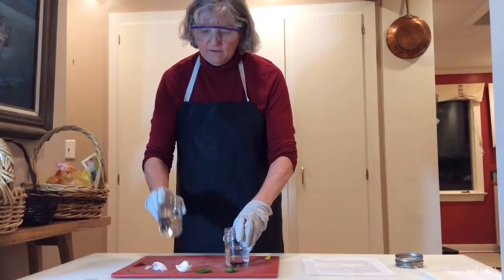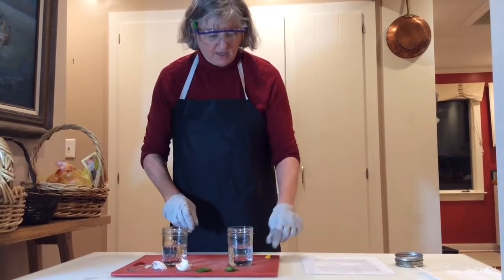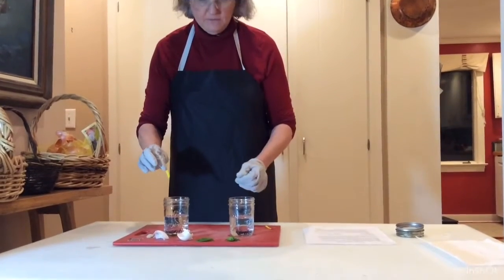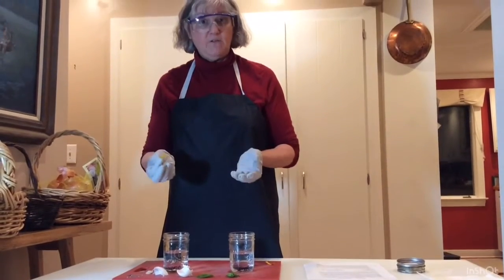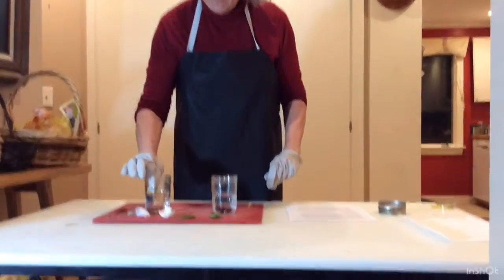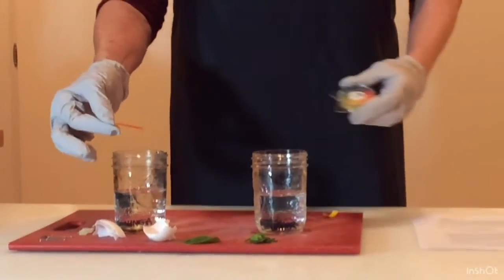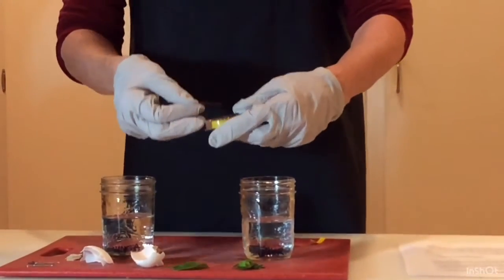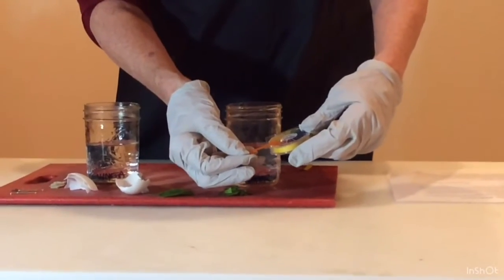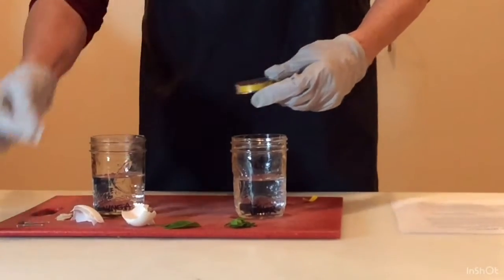So what do I have here? I have the vinegar, white wine vinegar, and water. And I know we did this the other day in our Zoom class, but just to remind you, I'm going to take the pH of these. So this is pH paper, and I dip it into the vinegar. You notice that it's a bright red color. And you go up here and you look and you match the color, and vinegar looks like it is really close to 3 actually.